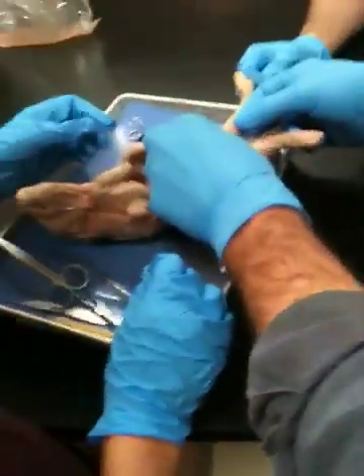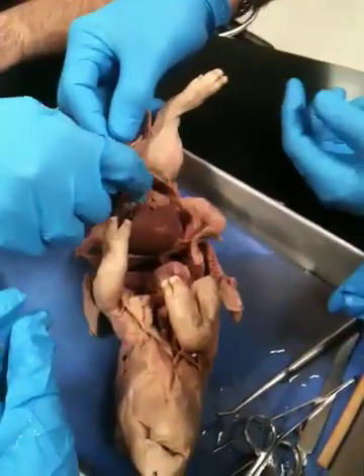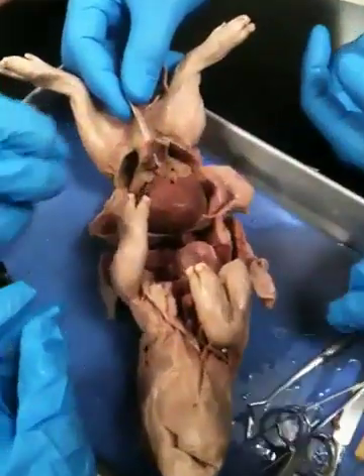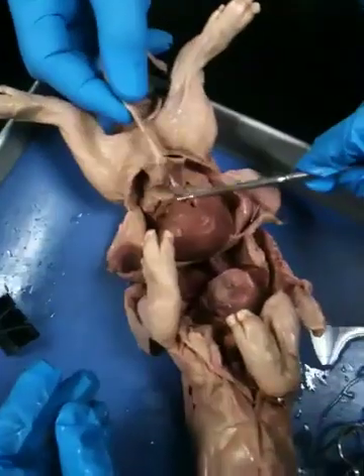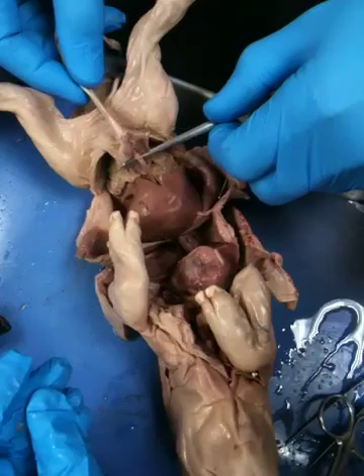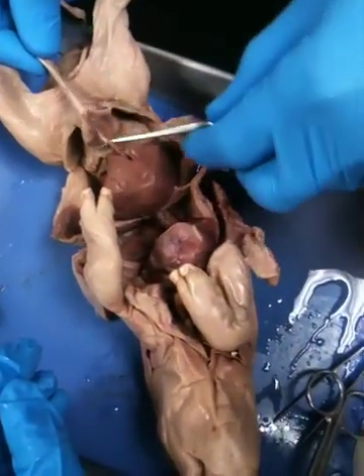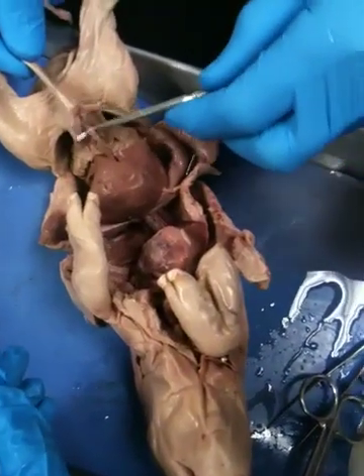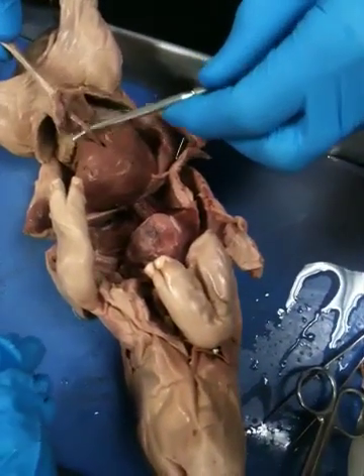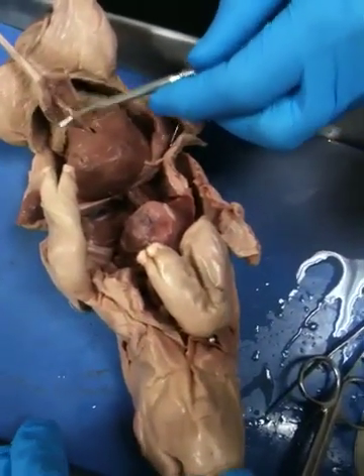What's this? Isn't that the internal umbilical cord? Internal umbilical cord? I've never heard of any such thing. What are you talking about, this thing right here? That's a nerve, right? No, you don't have nerves running from mama through the umbilical into baby. That looks like a vessel. As a matter of fact, the umbilical cord has to be connected with the vessels, doesn't it?